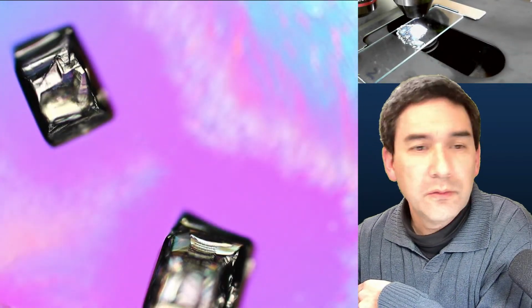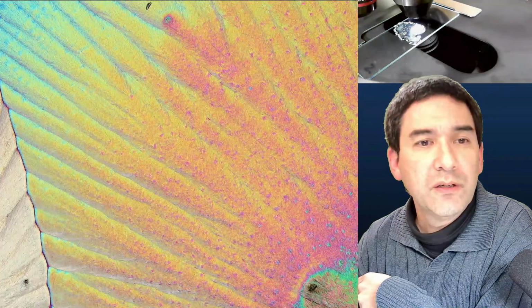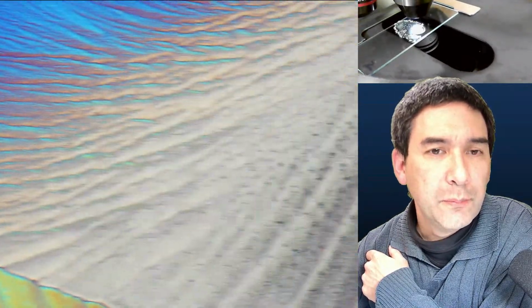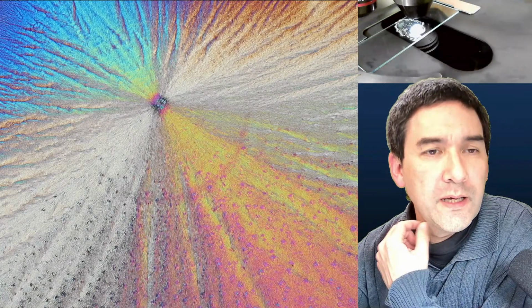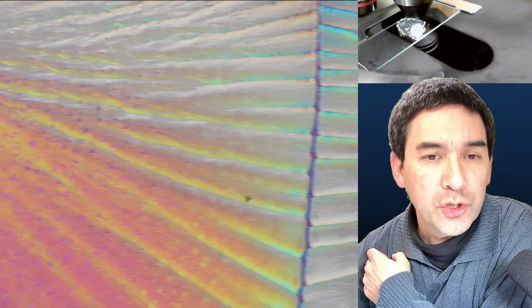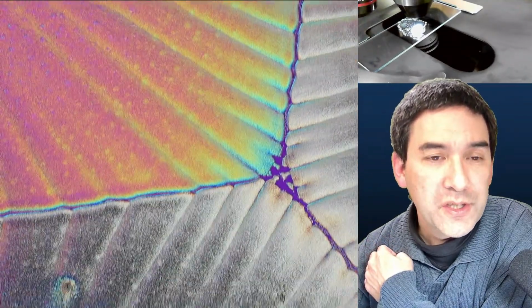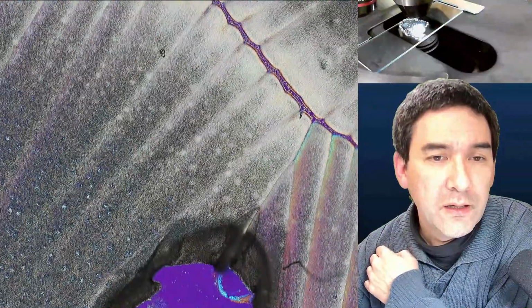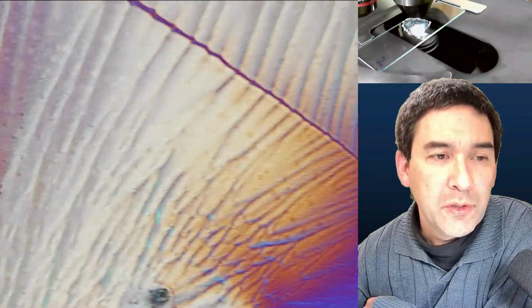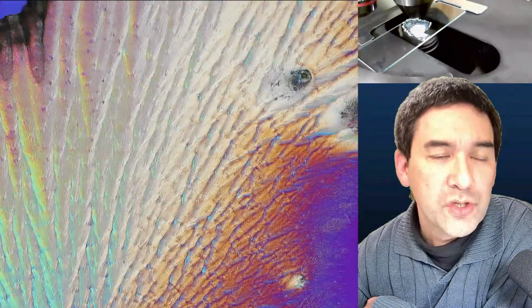Okay, so again here. So that's one that I also made already before. You can see the very typical flat crystals that we see here. Like a little bit like modern art. So, yeah, that's very typical. Vitamin C was actually quite difficult to do if you do not add the soap, because it will actually start to form very thick crystals otherwise, because the water droplet will pull together and it will be too thick. But because of the soap, you have actually thin layers forming, which is quite nice.